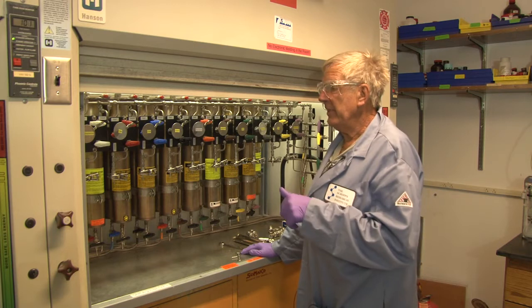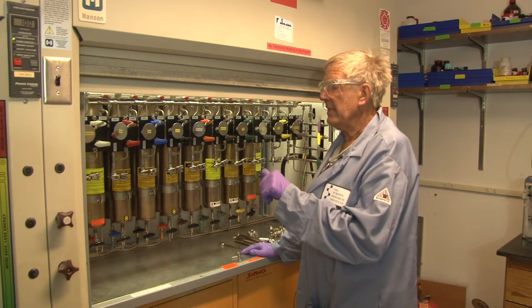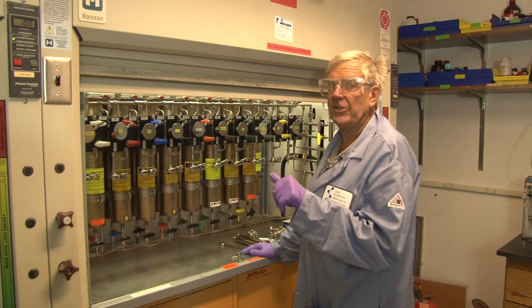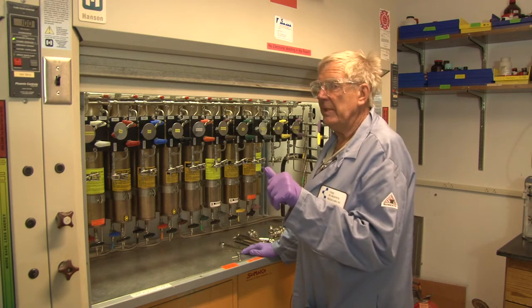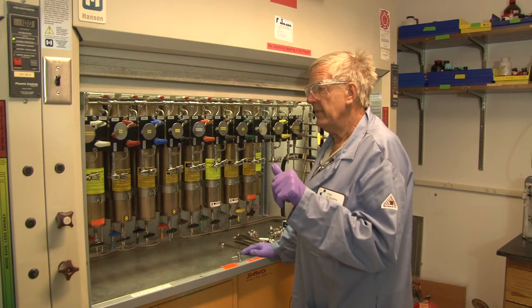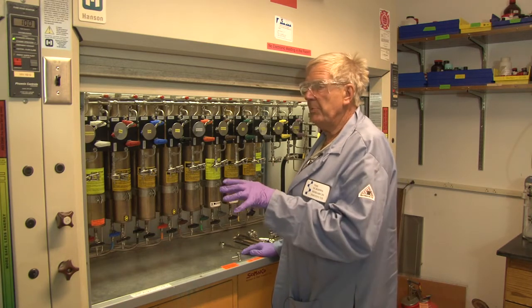The safety advantages of a system like this is that it does not emit any vapors and it operates at very low pressure — most of the time between 10 and 12 psi, and you can go as low as 6 psi. It is a push-pull system.